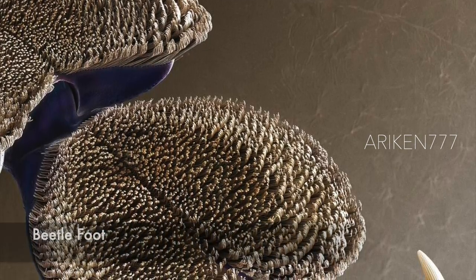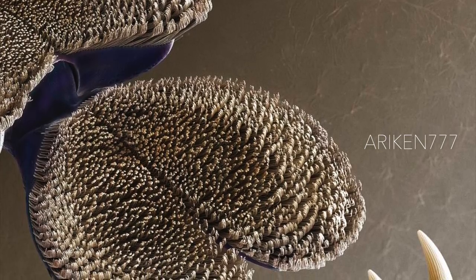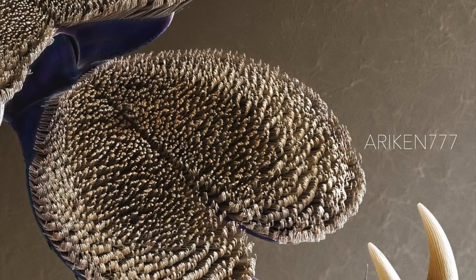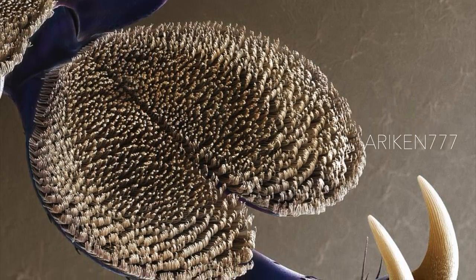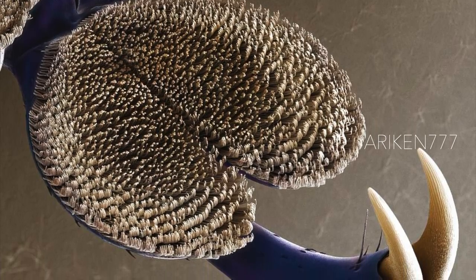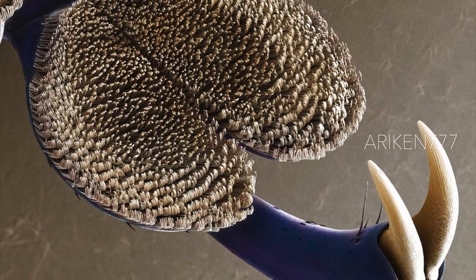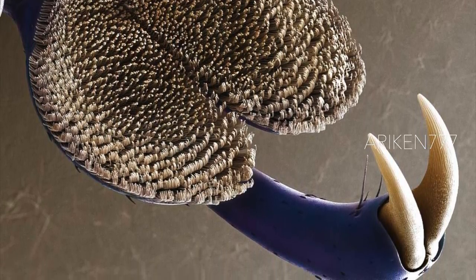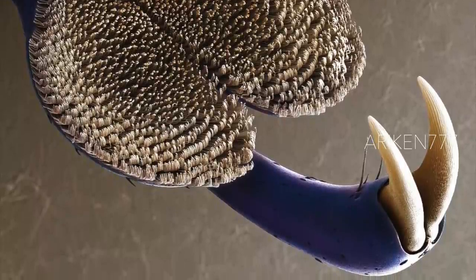This image shows the profusion of tiny hairs that this beetle has, enabling it to grip and climb slippery surfaces easily. Often known as frog beetles because of their long back legs, these colorful insects with a metallic sheen on their exoskeletons are killed by the thousands for the art market, where they are dried, framed, and sold. They are found in an amazing array of colors from variations of red, blue, and green, and originate in Southeast Asian countries such as Thailand and Malaysia.